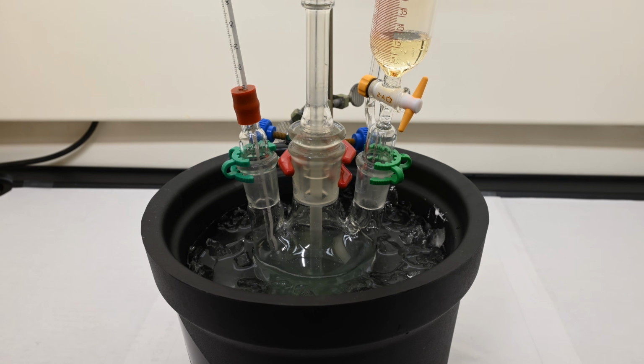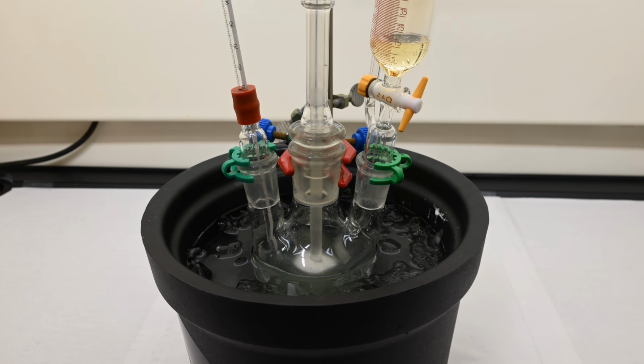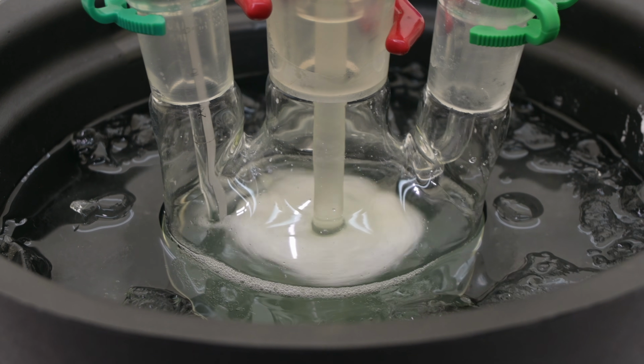In this reaction, sulfuric acid protonates sodium nitrite to form nitrous acid, which then reacts with N-butyl alcohol at low temperatures, yielding N-butyl nitrite, an ester of nitrous acid. Because nitrous acid is unstable and prone to decomposition, the reaction mixture must be kept near zero to control the rate and minimize any side reactions that could occur.